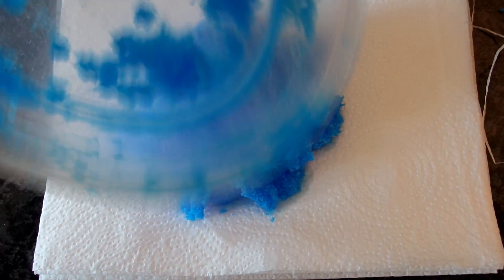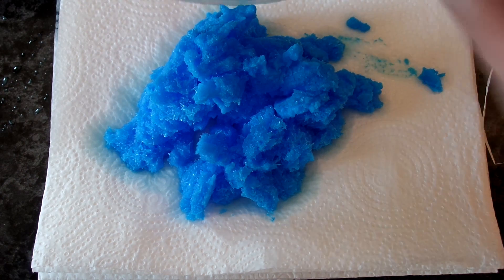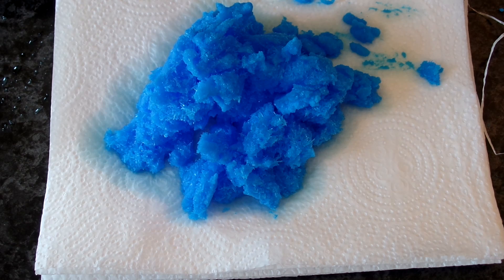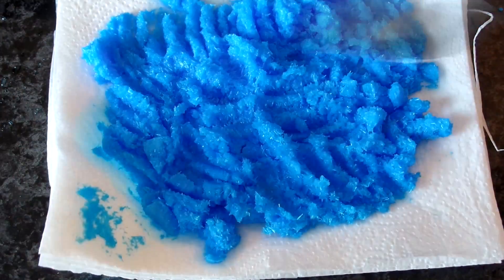The salt you see is copper sulfate. It's because of excess sulfuric acid in the mix. After all the crystals have been collected and dried, I got about 150 grams of copper sulfate, which is about 60% yield. It is so low because of all the lazy washings.